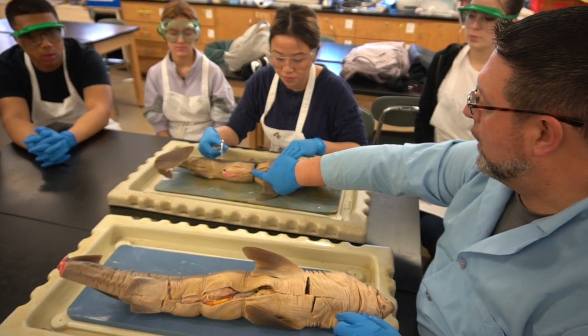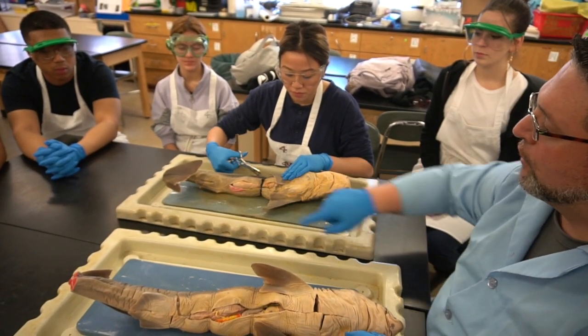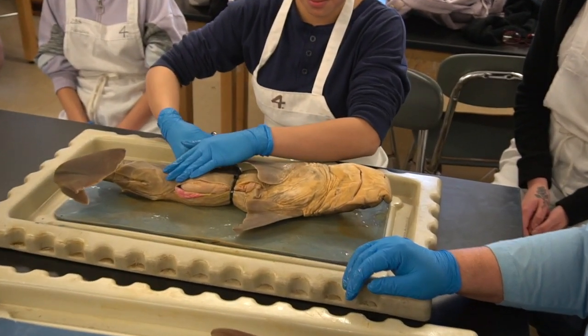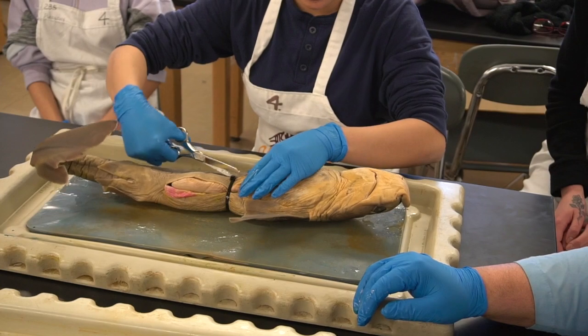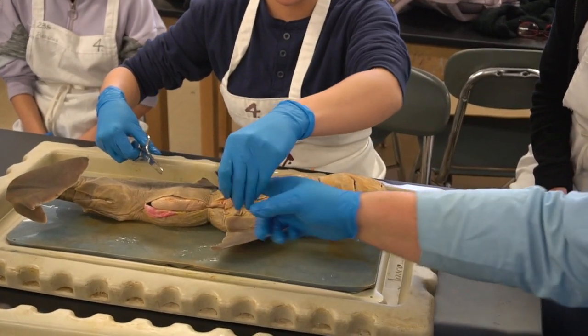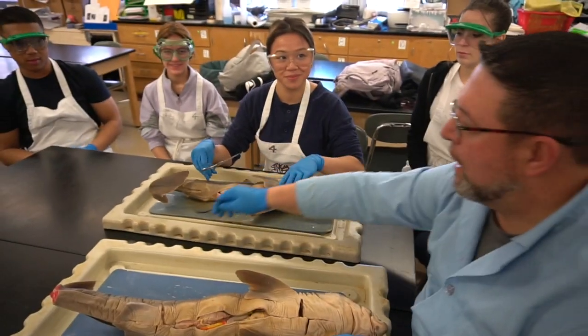So this is a simple cut. It is a zip tie, so just be careful as you cut through it that it doesn't pop in your face. Just cover it with your hand. Okay. Yep, it's hard plastic. So get under it a little bit. There you go. Use a little more force. Very simple. Dispose of that.